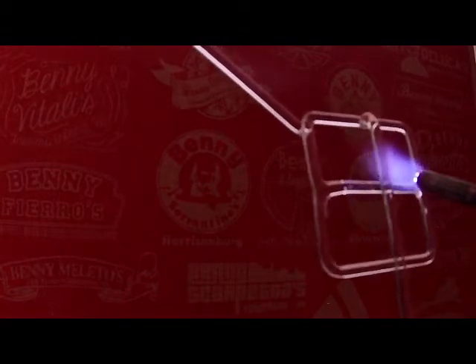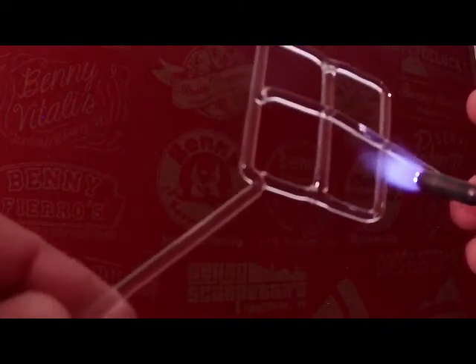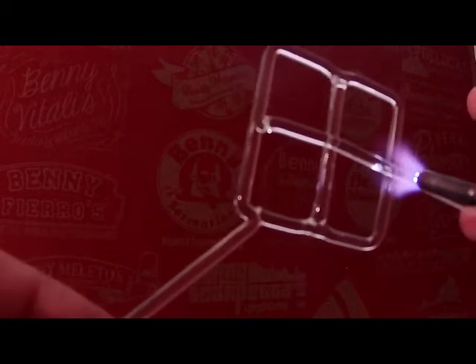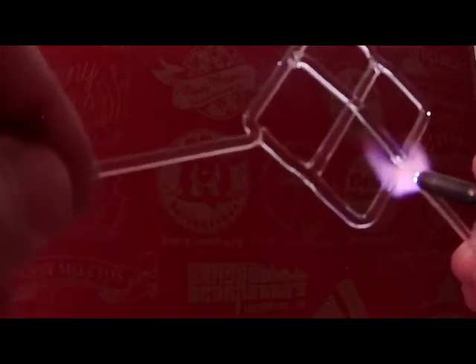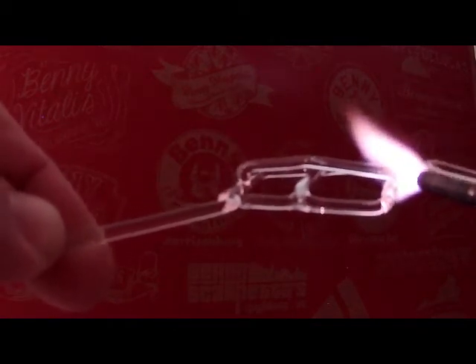If you push too hard and you deform the top, once you complete the welds, you can come back and fix that. So now what I'm going to do, I'm actually going to heat the center of this rod a little bit, so that way it essentially bends, so I can have a good point of contact when I come over here, line that up. I'm moving it over here, I'm kind of swiping the glass down so that way it makes contact.